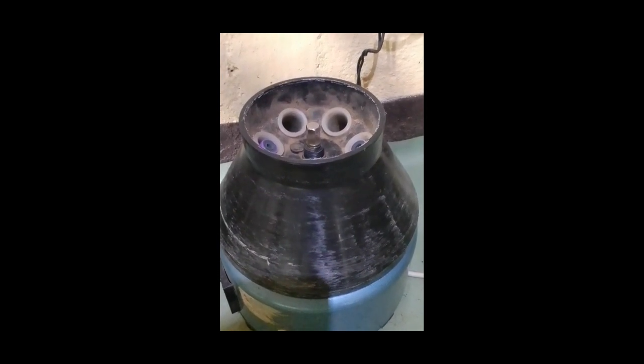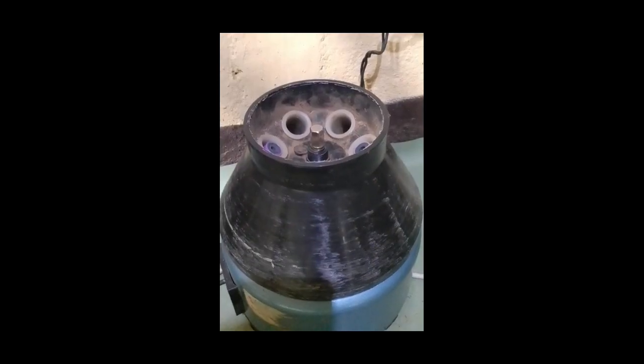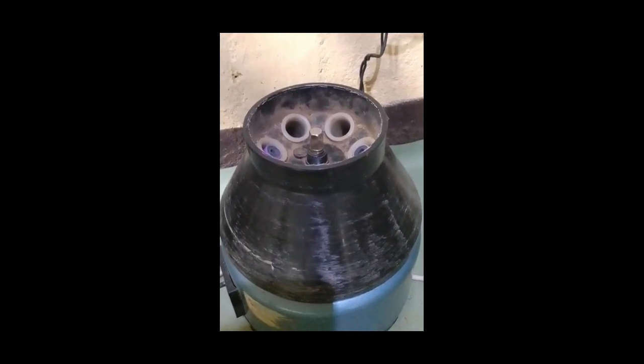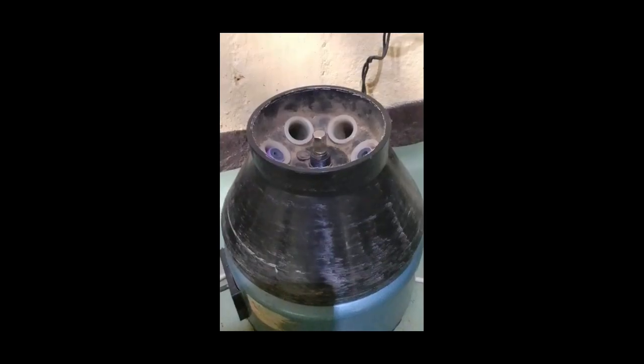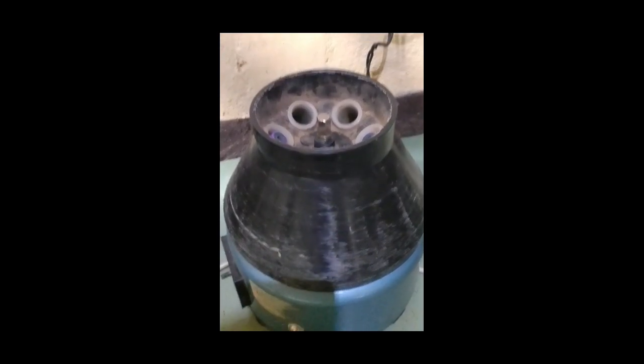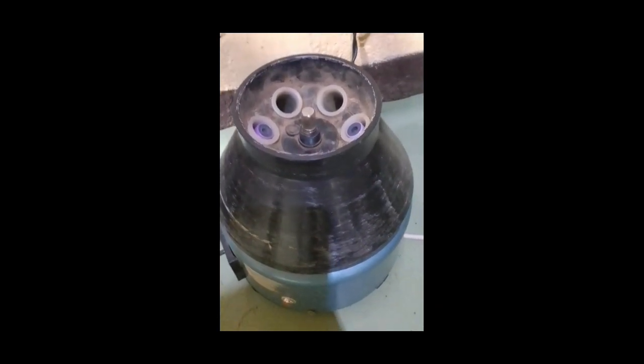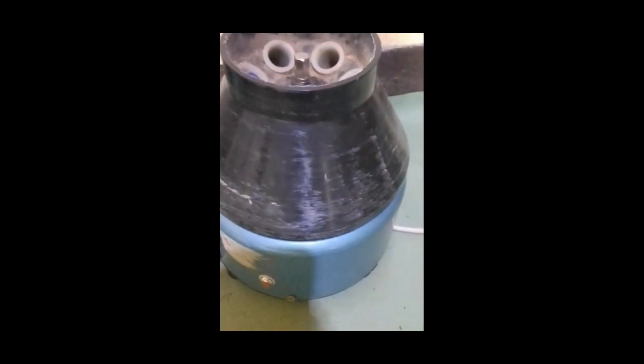Separates plasma from blood. It is used to obtain plasma from anticoagulated blood samples for various laboratory analyses. Concentrates urine sediment. It helps concentrate cells, crystals, bacteria, and casts in urine for microscopic examination. Prepares samples for testing. It removes unwanted particles and prepares clear samples for accurate laboratory testing. Separates blood components. It separates red blood cells, white blood cells, platelets, and plasma for diagnostic and therapeutic purposes.